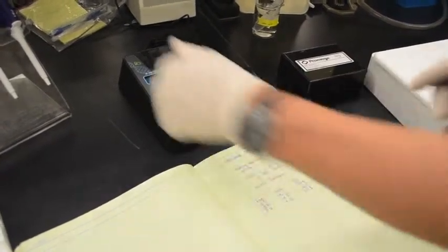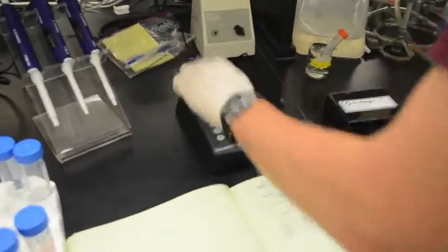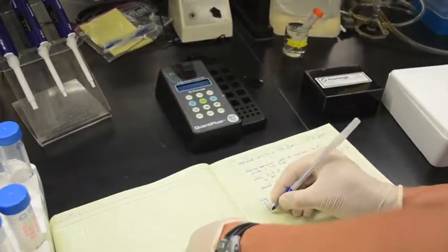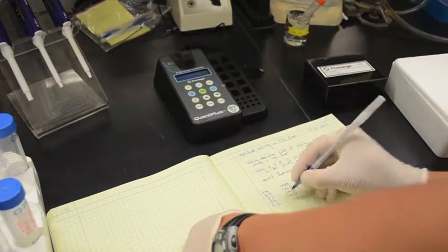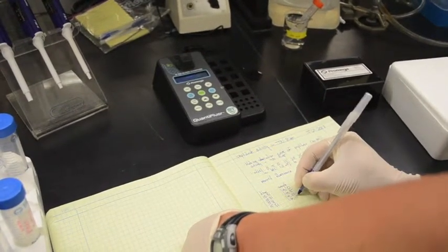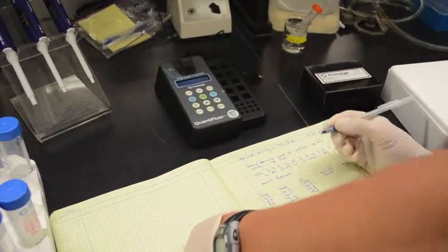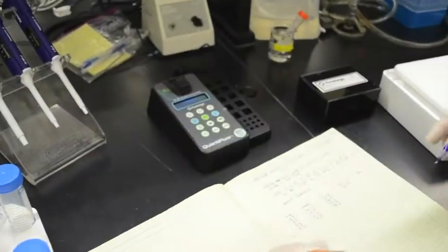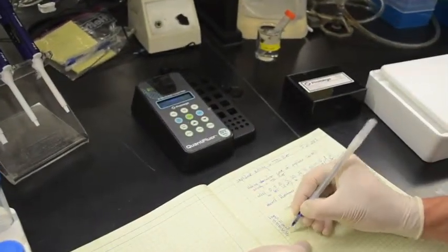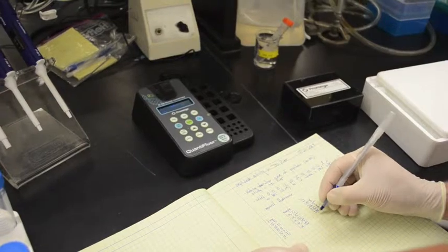And it's not surprising that the fluorescence is going up even at the very beginning of the experiment before the enzymes have had time to do much, because there's a little bit of background fluorescence to the substrate that we added. But remember, we're not looking at the value of the fluorescence, we're looking at how fast the fluorescence changes over time. So I'm going to go through this whole row and then the whole row of killed samples and record the time and the fluorescence for each one, and that will be my set of starting values.